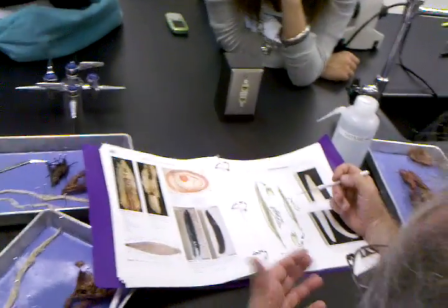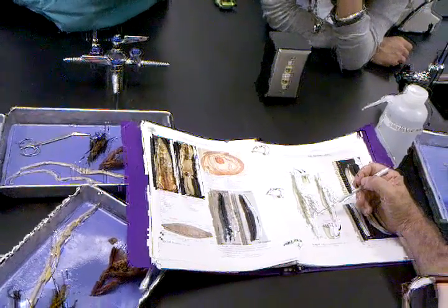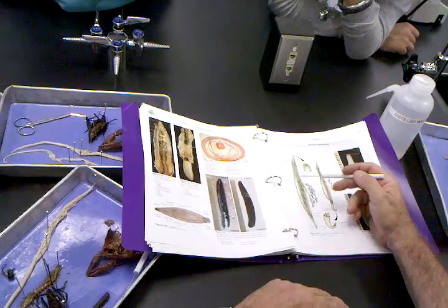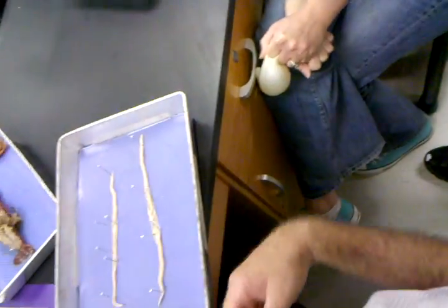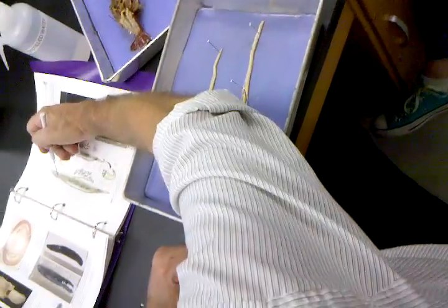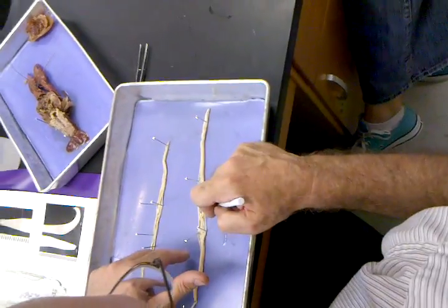Basically, male and female — most of these parasitic worms are almost all gonads, a reproductive machine. They've got an intestine, and the rest is gonad. Basically the female is one long tube. Ovary is the finest tube, then oviduct, then uterus. Basically, you've got a forked uterus there with the ovary and oviduct wrapped around it. You're looking at a uterus with ovary and oviduct that has been wrapped around it. The intestine is easy because it's a long, flattened structure that runs the entire length of the animal. Let me look for the intestine.